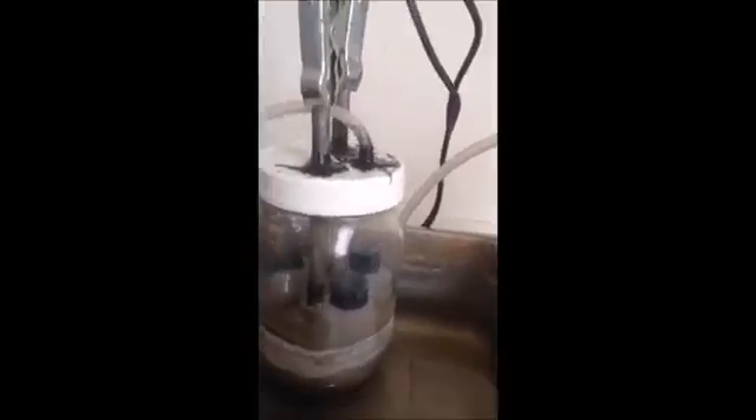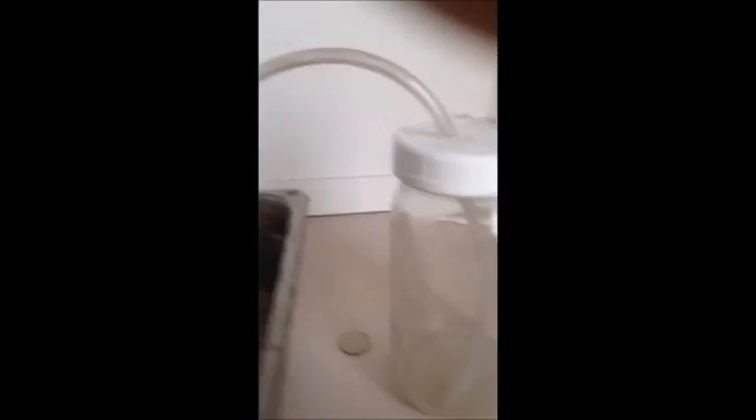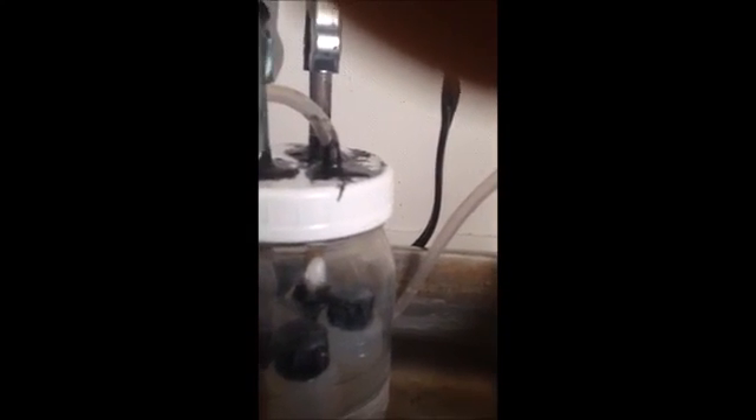Either way, I am not doing magnesium again. There's a little bit of water inside this tube, as expected. I put this extra jar here to catch the water that gets out, and I didn't catch much — hardly any, really. Most of this was actually during the beginning when the solution was way up here, but as it boiled down it did start running down the side. It wouldn't actually go up and out. The cooling bath probably helped significantly with that.